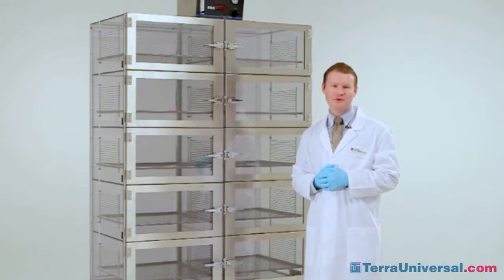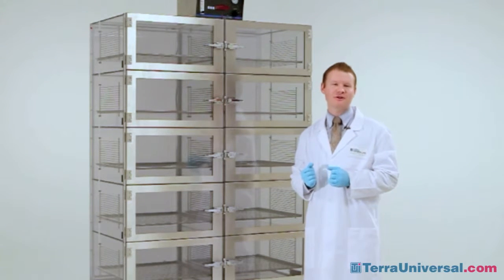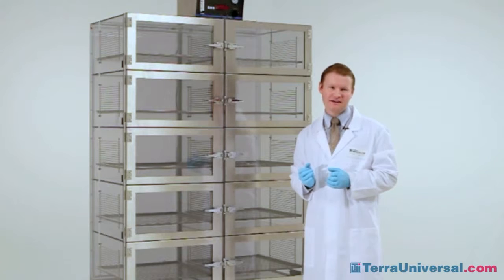We're here today to give you a brief overview in properly leveling your cabinet and ensuring that all of your doors are aligned.